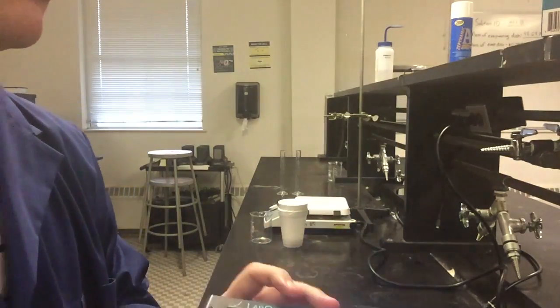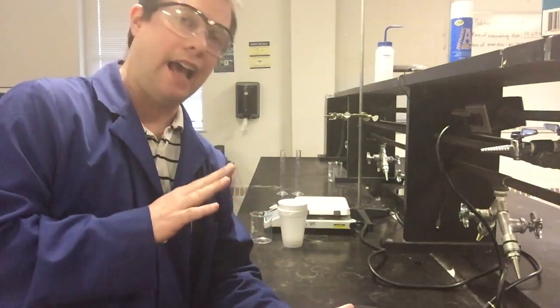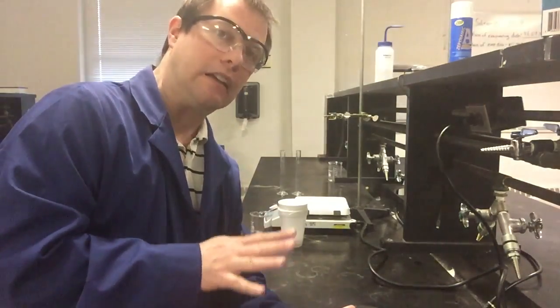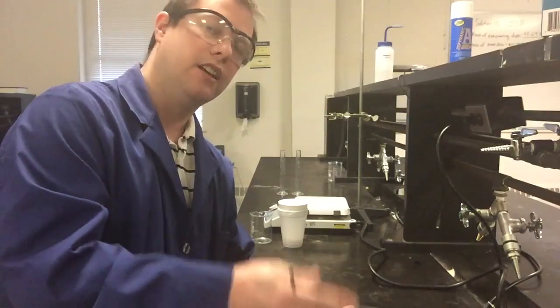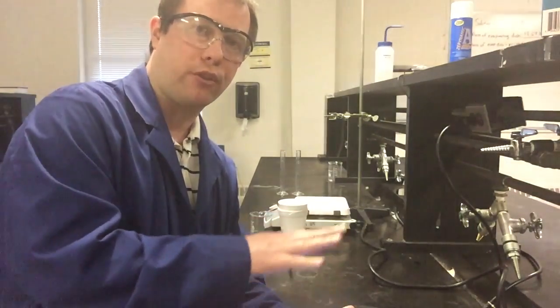And so when I'm done with this experiment, I'm going to take all of the data from this lab and have it in an Excel file, and you'll have that Excel file accessible where you can see all of this data, get out the information that you want so that you can then do all of your calculations. But I'm going to stop here for the first part.